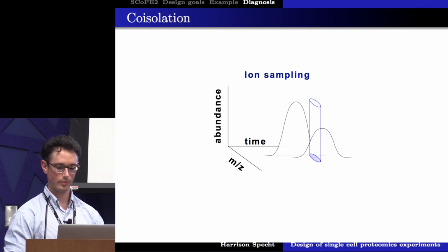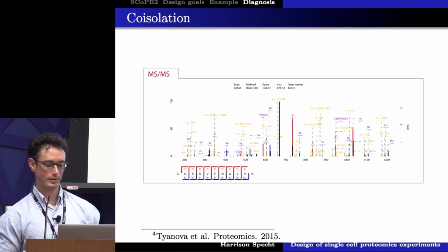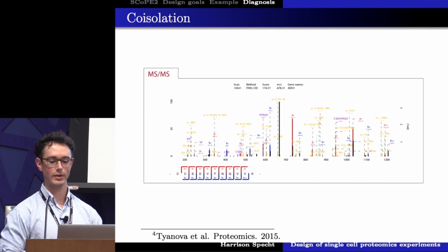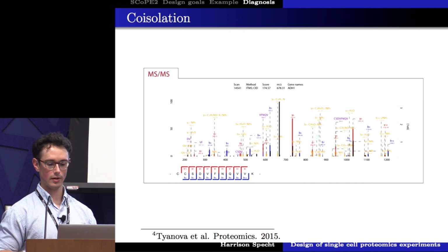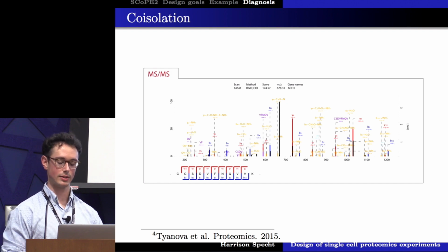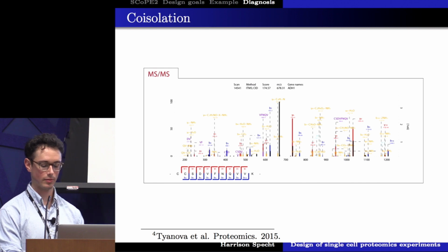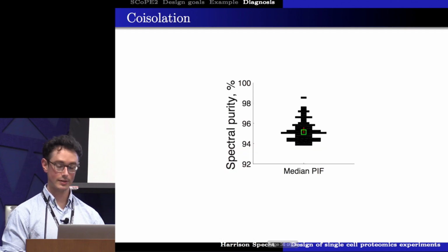And what we have, fortunately, at our disposal is a lot of different search engines that are very, very good at annotating the spectra that we acquire and figuring out all the different possibilities of which of those fragments come from our peptide of interest, and if there are any other fragments in the spectra that could be coming from coisolation, and then quantifying the amount of coisolation that we could see. This is just one example from MaxQuant, but other search engines can do this as well. And we can assess that directly.